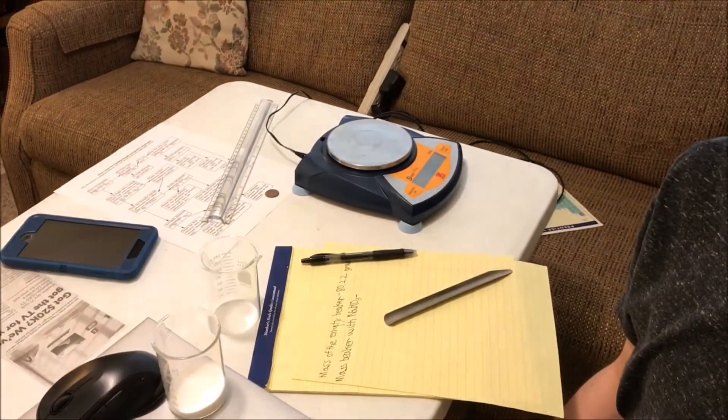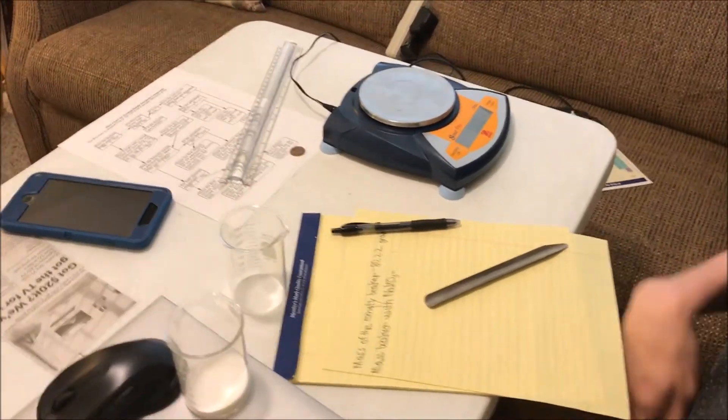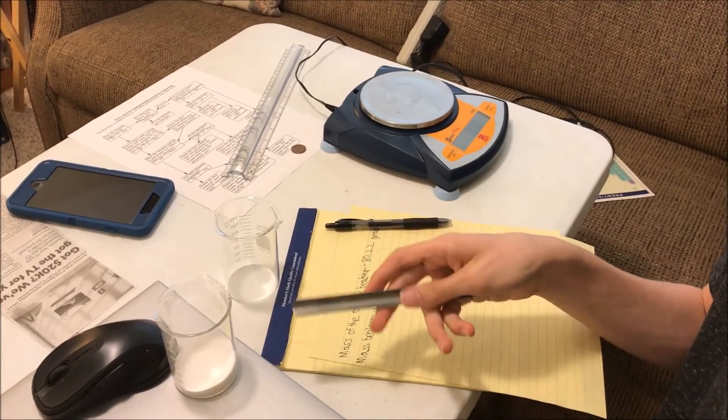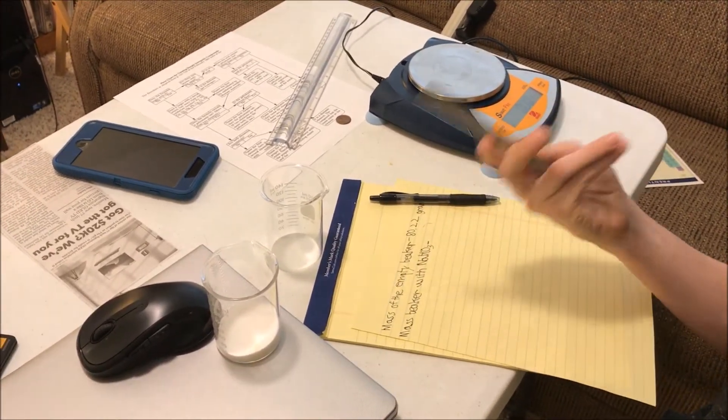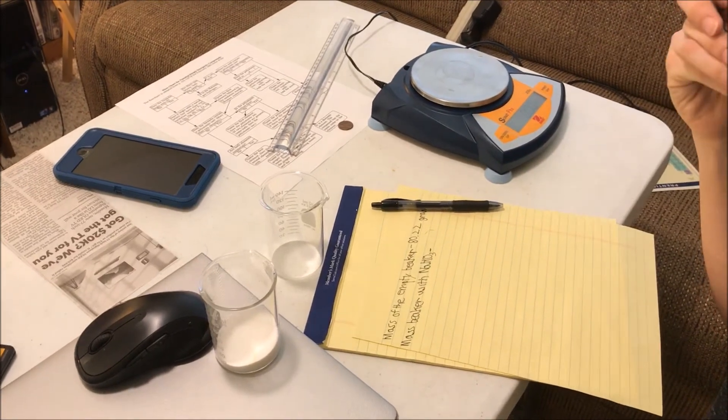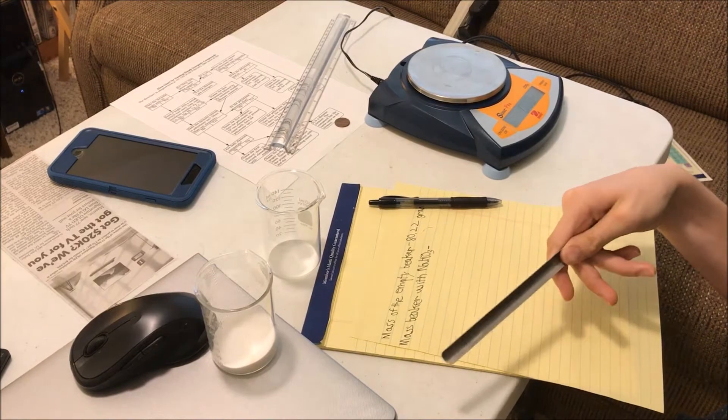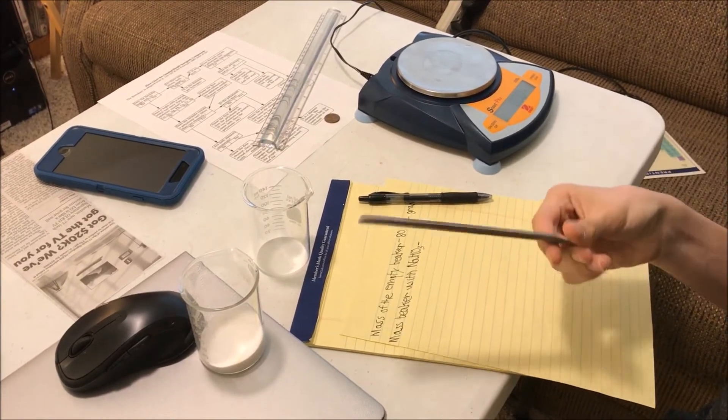Hi, I'm Pi Guy Pepin and I'm the cameraman Chemical Charlie. Today we're doing an experiment with sodium bicarbonate, or baking soda, mixing it with hydrochloric acid to form water, carbon dioxide, and NaCl table salt.